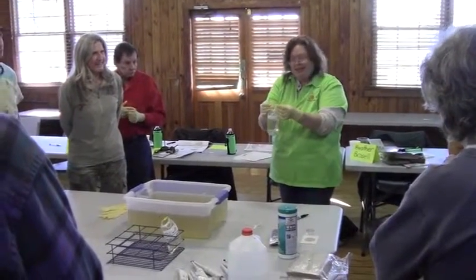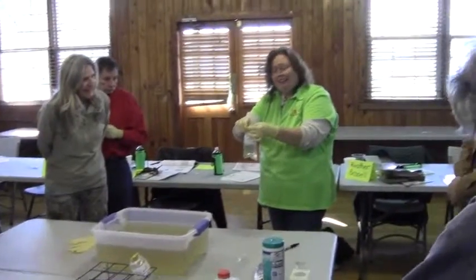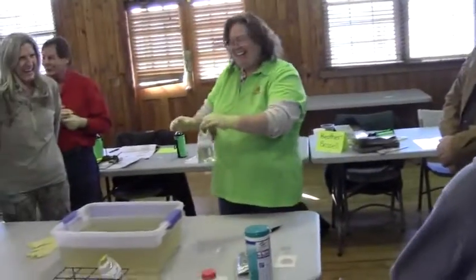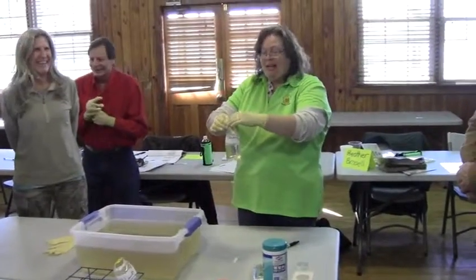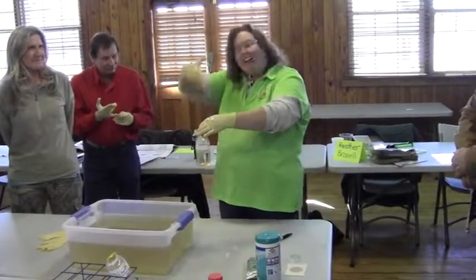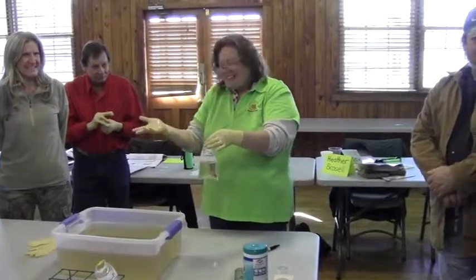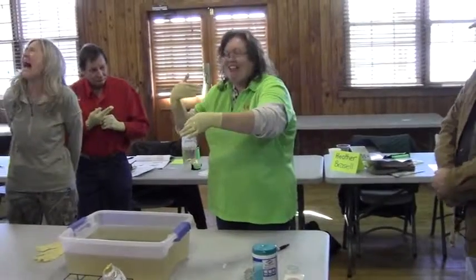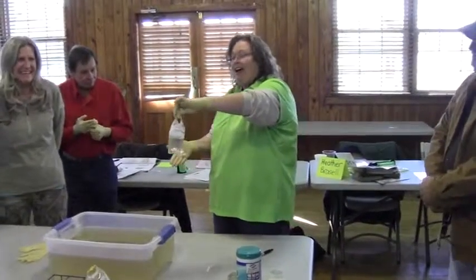So if you've got water that's got a lot of E. coli in it, and you're doing your little swirly cue, and you swirl some of it in your face — just make out your will as soon as possible, before you go! I'm as blind as a bat, I have to make sure I'm looking towards the bag. Turn your head so you don't have to spin. Safety glasses wouldn't hurt either, but like I said, I can't see, so I'm looking towards what I'm doing. You can turn your head and whirl away from you.